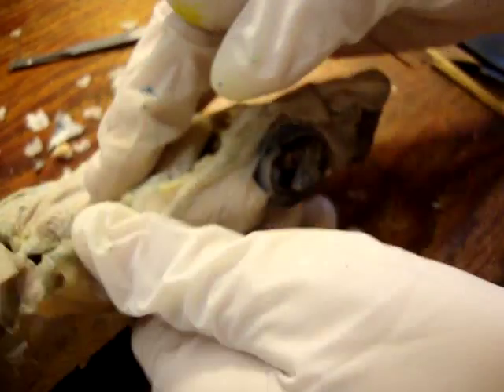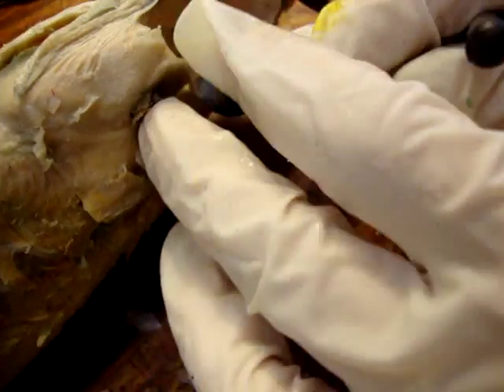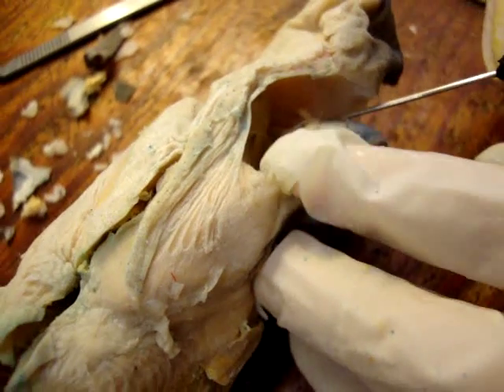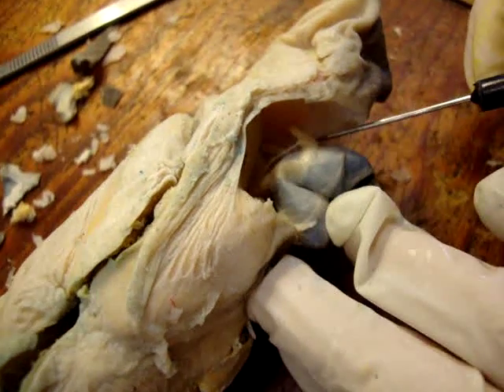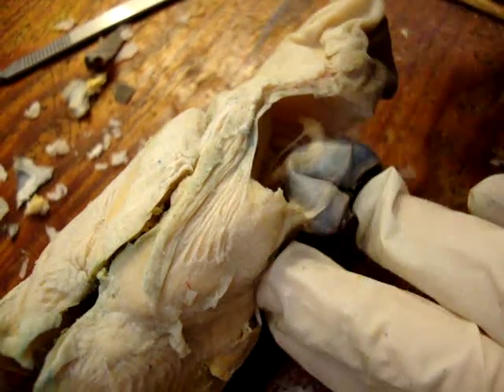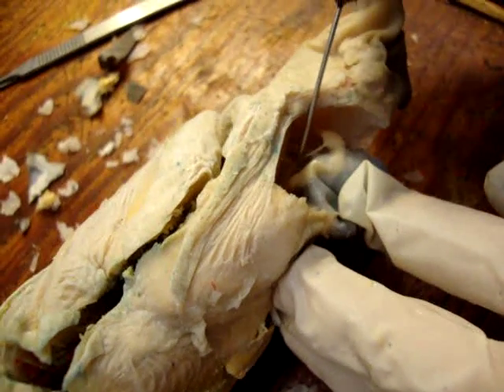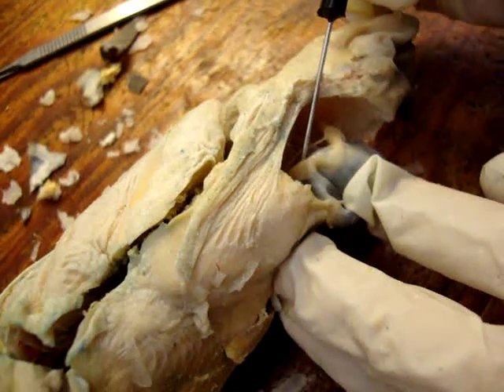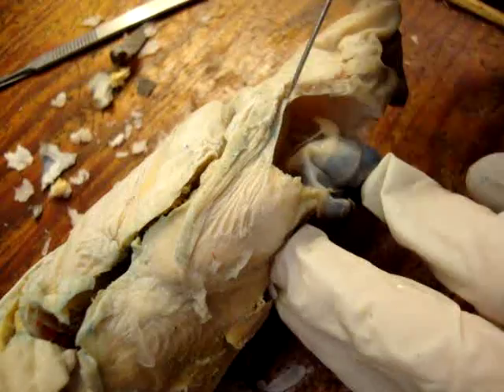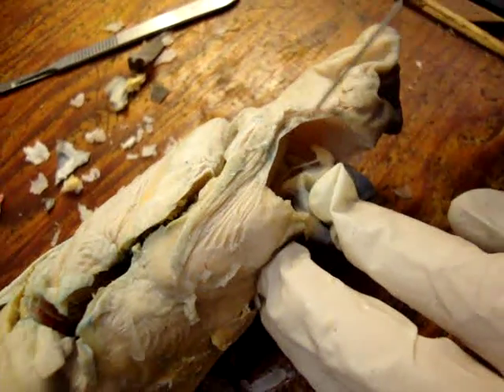And then when you flip them over, the inferior oblique is on the side. And then inside is the inferior rectus. And then the lateral rectus. And then the optic nerve once again, which runs along here.